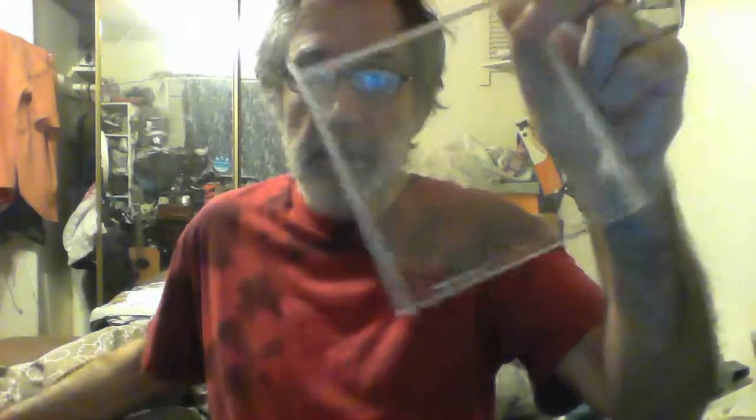Here's a quick cool little thing. I can use the back case too - right into these. These are homemade microscope slides, I haven't tested them yet but I think they'll work just as good as glass or the plastic ones you get in the package. I got about 10 out of that one case. They're a little short going from side to side, so maybe cut it down to five depending on your needs.